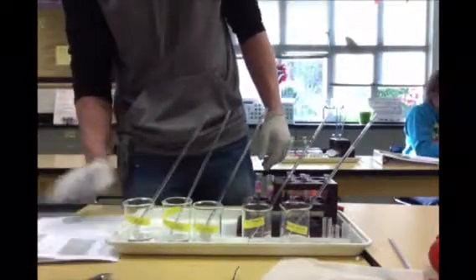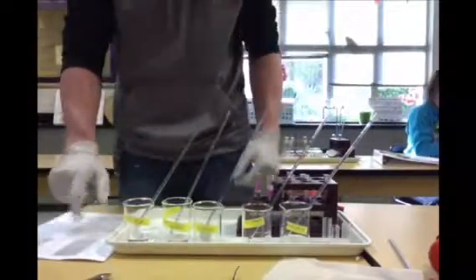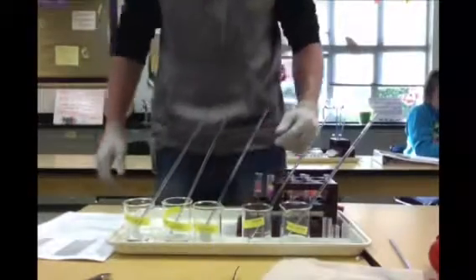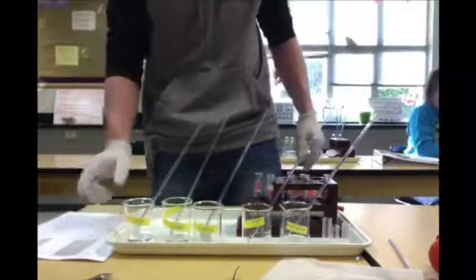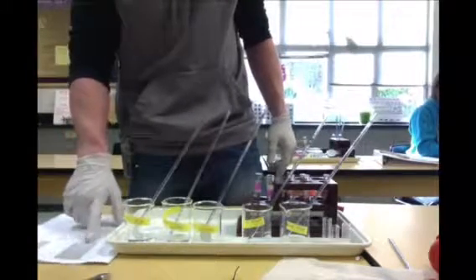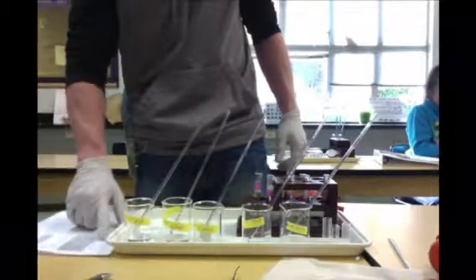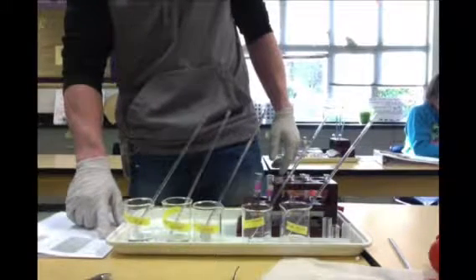From here, I'm now going to mix all my S1, S2, S3, and my E1, E2, E3. Now, E1 is going to require 2 milliliters of the pH 5 buffer, 0.5 milliliters of peroxidase enzyme extract, and 1.5 milliliters of the phosphate buffer. My E2 will be 2 milliliters of the pH 5 buffer, 1 milliliter of peroxidase, 1 milliliter of phosphate buffer, and my E3 will be 2 milliliters of pH 5 buffer, 0.25 milliliters of peroxidase, 1.75 milliliters of the phosphate buffer pH 7.